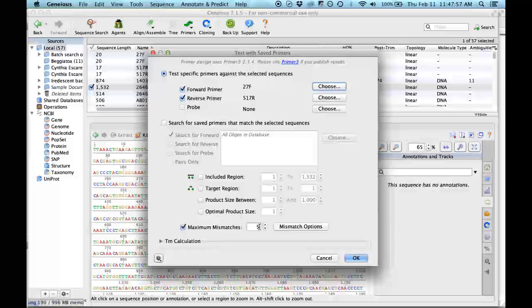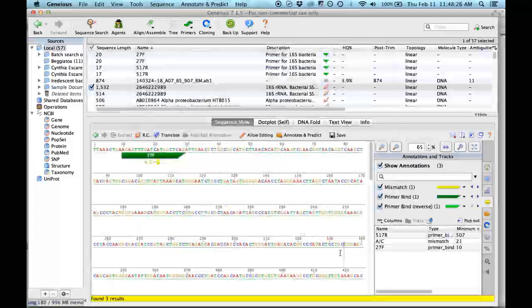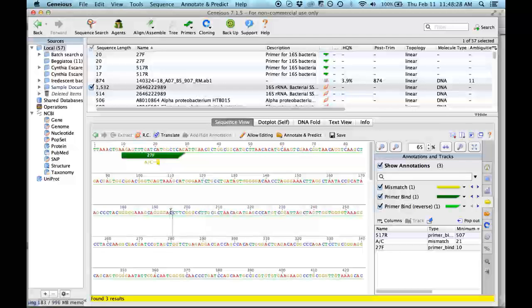You have it here. I said 5, but it could be less. Let's put 4, because the primer is about 20 base pairs, so you cannot put a big number, otherwise it depends. If you just want to look for the position, you can allow a lot of mismatches. But if you are checking whether your primer will work to amplify some bacteria, then you cannot use too many mismatches.